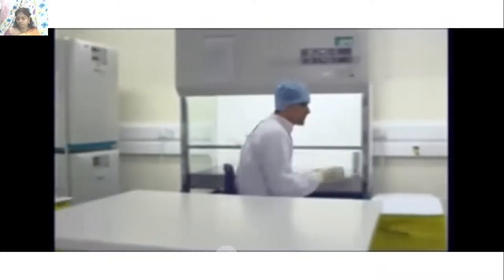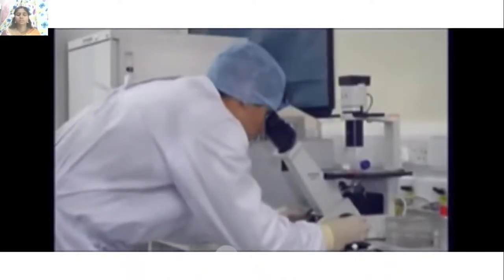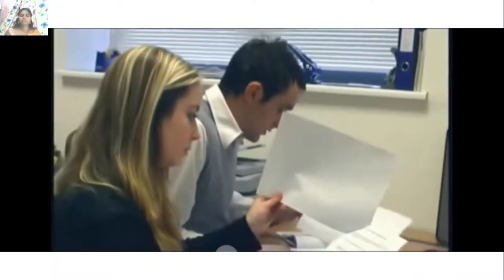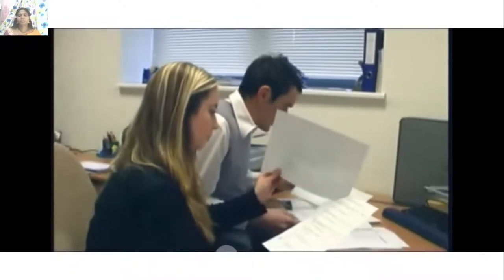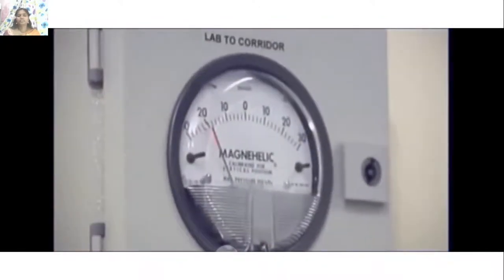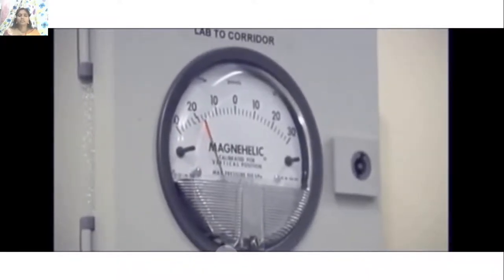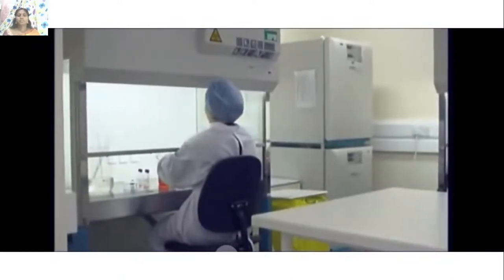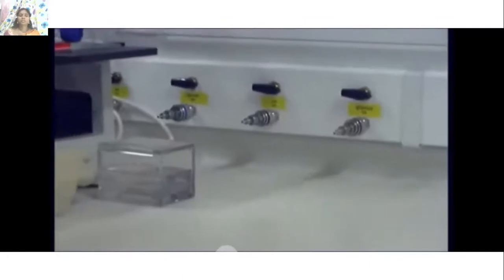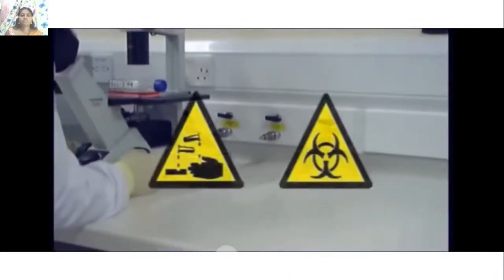Cell culture should be performed in a dedicated facility. Cell lines pose a potential health threat, so you must consult local safety and environmental regulations, and always carry out a risk assessment before working with any cells or cell lines. At the European Collection of Cell Cultures, laboratories are operated at negative pressure to contain potential contaminating aerosols. Laboratory surfaces including bench tops, walls, and flooring should be smooth, easy to clean, waterproof, and resistant to chemicals.